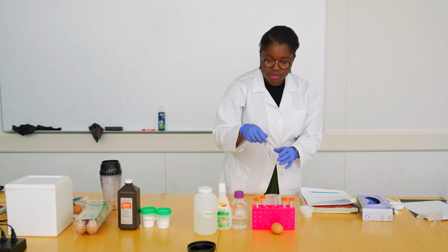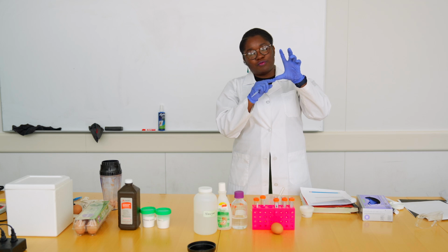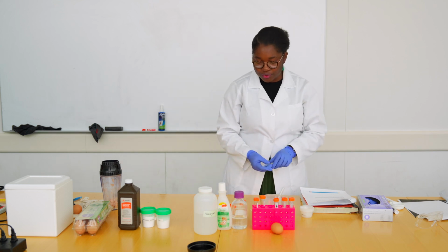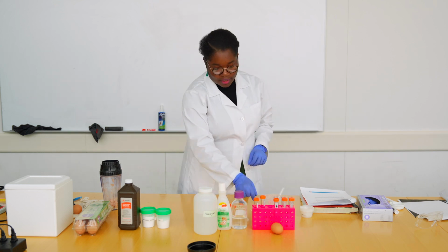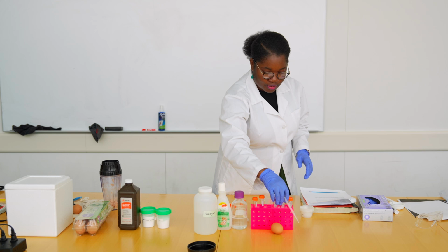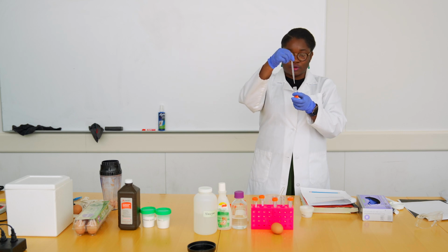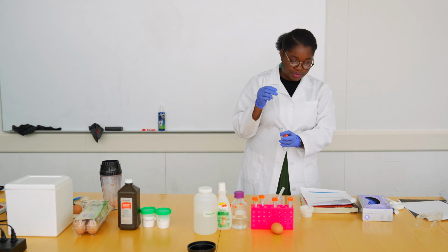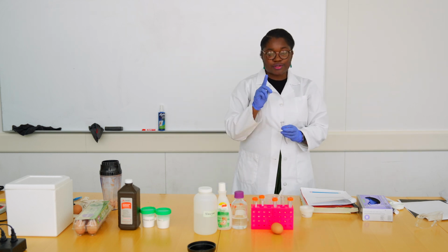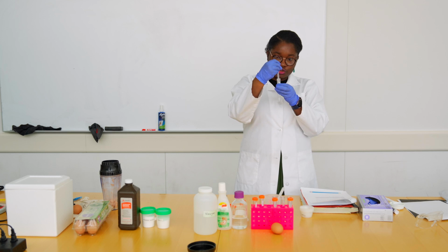So earlier we measured how much foam was in our tube after our reaction with just hydrogen peroxide and the potato juice. So we are going to be doing the same this time. And I need, again, the hydrogen peroxide to be added to our tubes. I need 20 drops in the first tube, so that is going to be about 2 ml. And in the second tube, which is our control catalase, I need, again, 20 drops of that. In the third tube that does not have the potato juice, I will add 20 drops of the hydrogen peroxide.